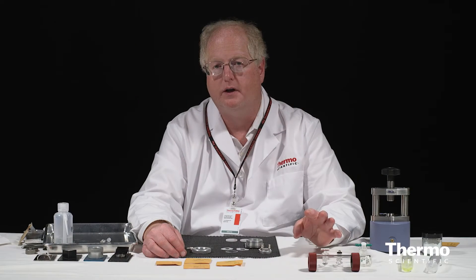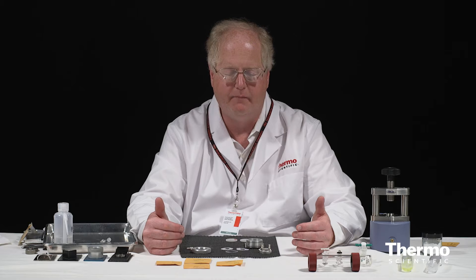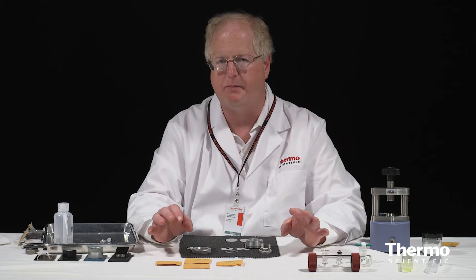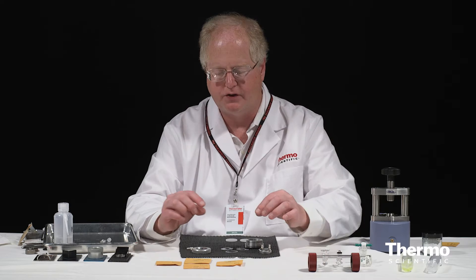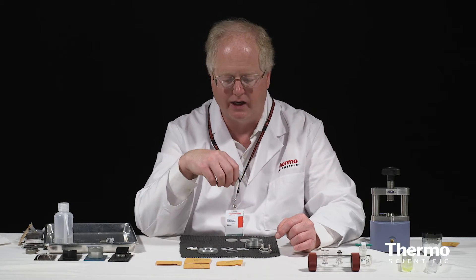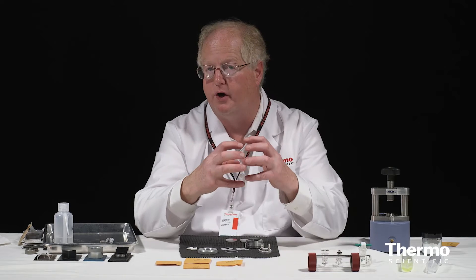For liquid samples in transmission spectroscopy we use various transmission cells. There are many different kinds, including permanently assembled ones where they just have fill ports. You can get ones that have screws rather than this type of assembly to hold the cell together, which allows you to generate higher pressure in sealing it — which is both good and bad because it can cause cracking of the windows.